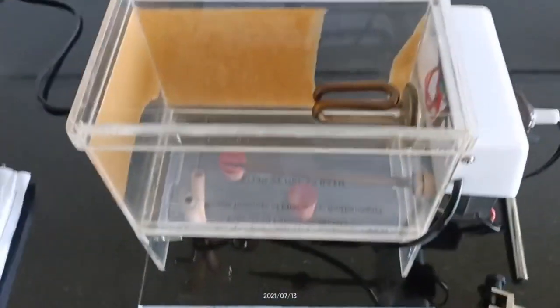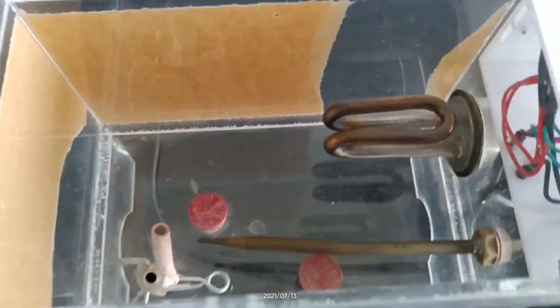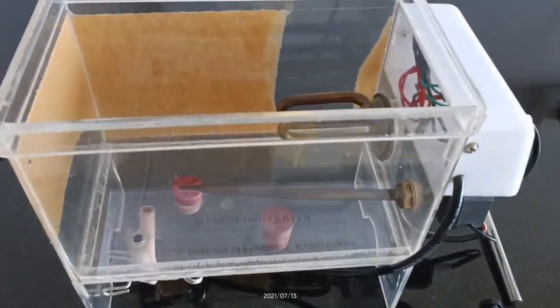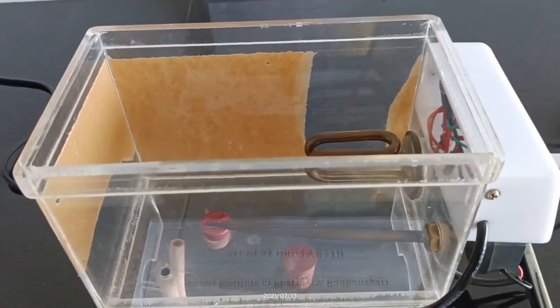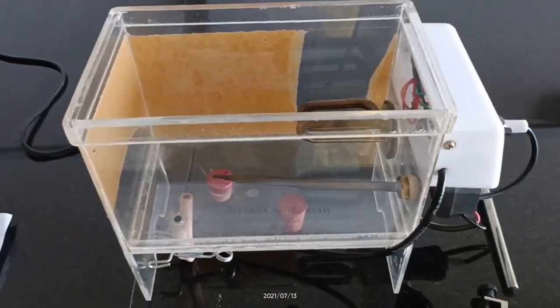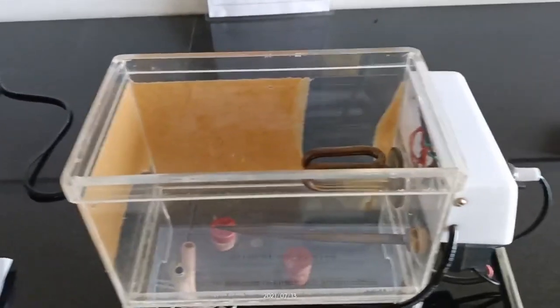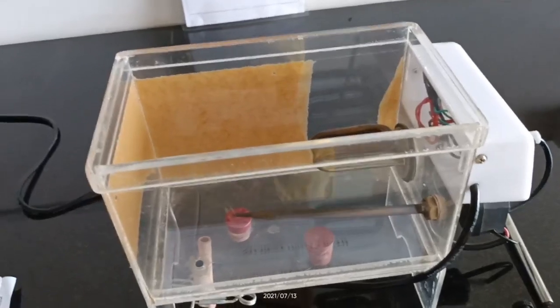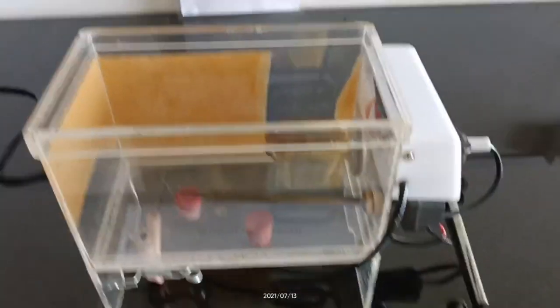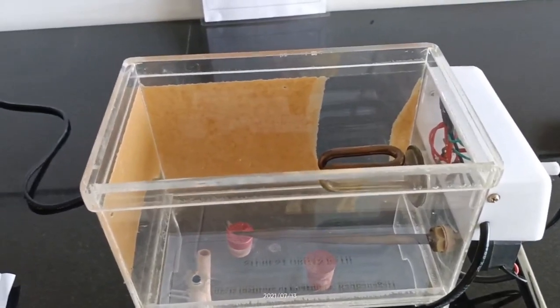Now let's look at the uses of the student organ bath. The student organ bath is mostly used for pharmacological research purposes. It is used for studying the contraction and relaxation of smooth muscle tissue.